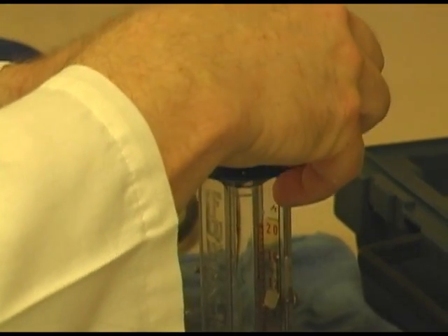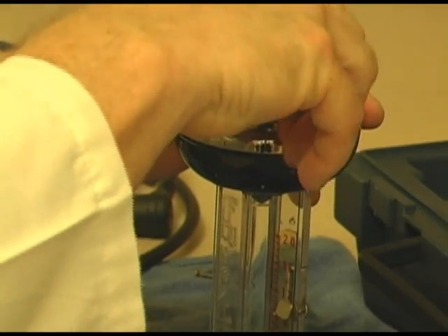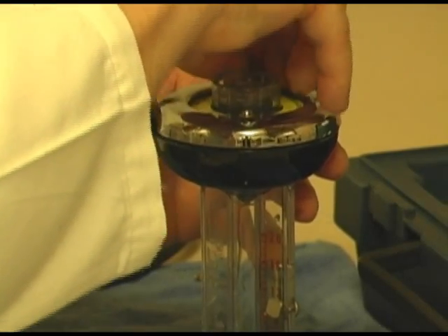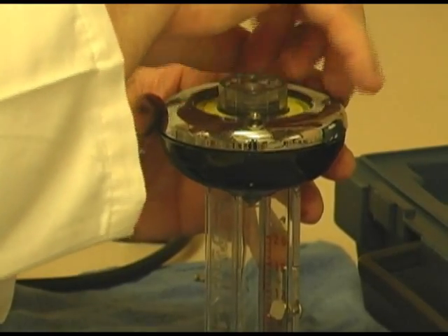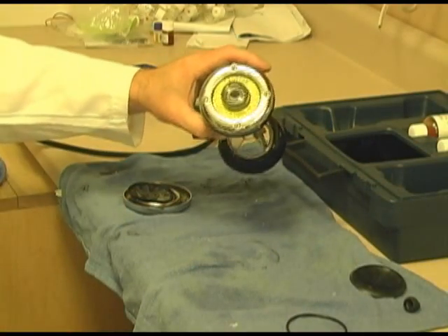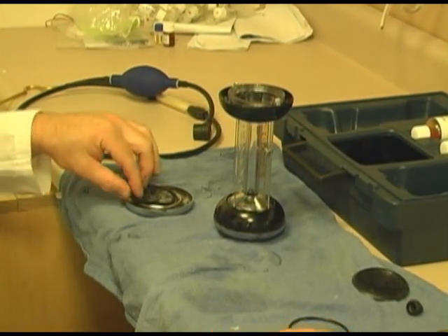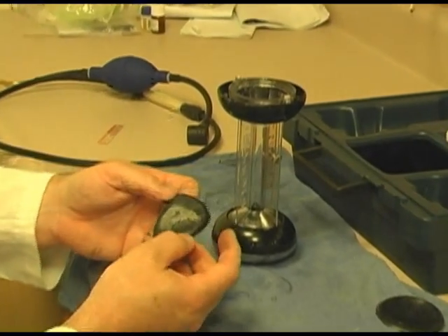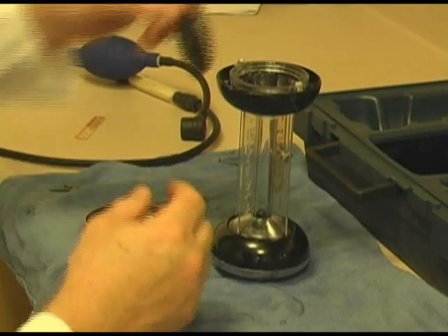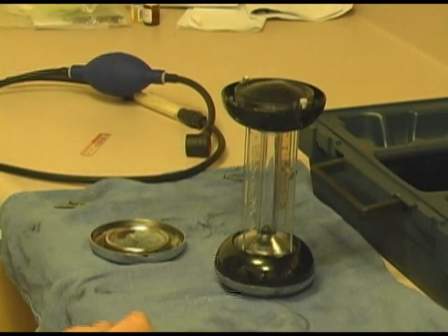And put in this, line up the screws a little. And we're only going to put 2 in for right now. Now that we've got our 4 screws in, let's start working on the bottom side. Here's the old gasket. You can see the torn material. I'll throw that away. Now we're going to put a new gasket inside. Here's the new gasket. Relatively simple. It just goes right in.